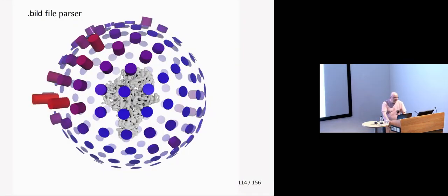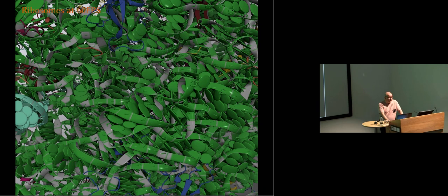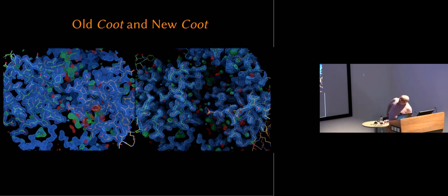You can use bild files to represent preferred orientation. You can use map masking, and this is again SARS-CoV-2, spike protein. You can use it for ribosomes, and that works rotating at 60 frames a second just fine. And I don't know whether you can see that. That's the old Coot versus new Coot.